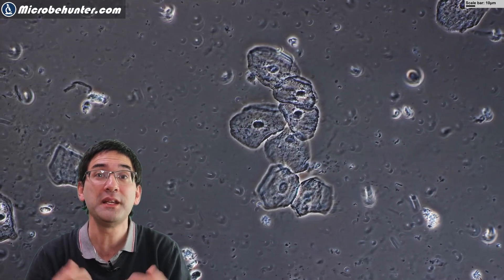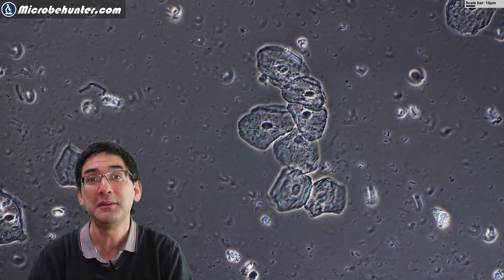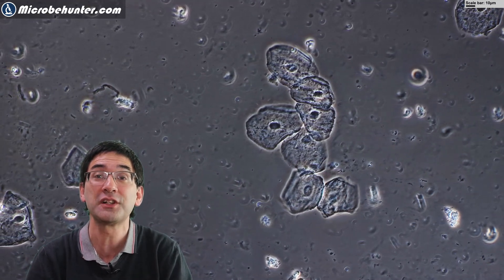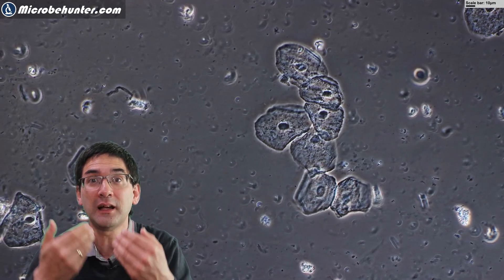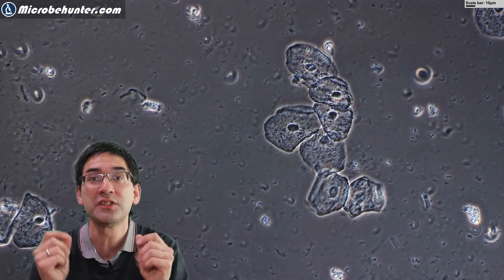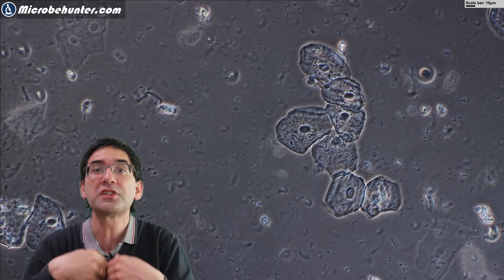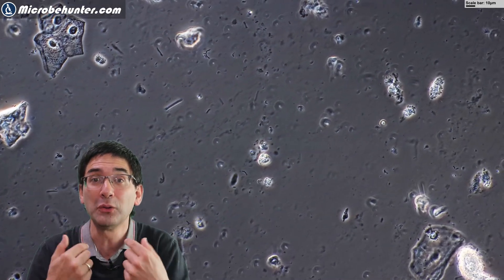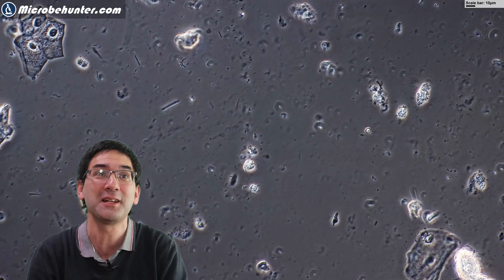The mucus, as a matter of fact, is a very important protective thing, because it catches all of those dust and dirt particles and also bacteria that you might inhale. And the inside of your respiratory system is lined with little hairs, so-called cilia, and they beat and move and they move the mucus up again. Then you cough and swallow it — and this is how the respiratory system cleans itself.